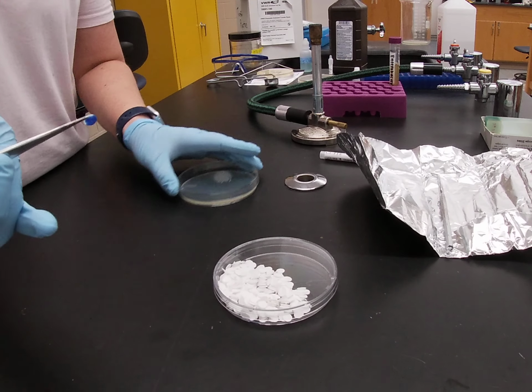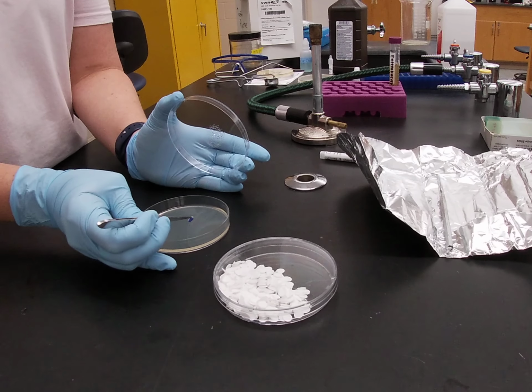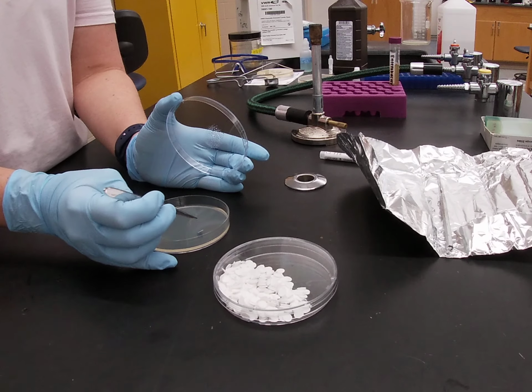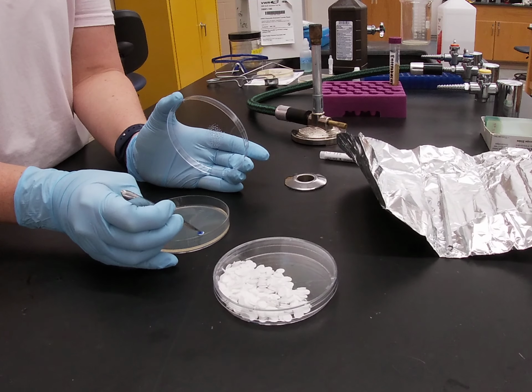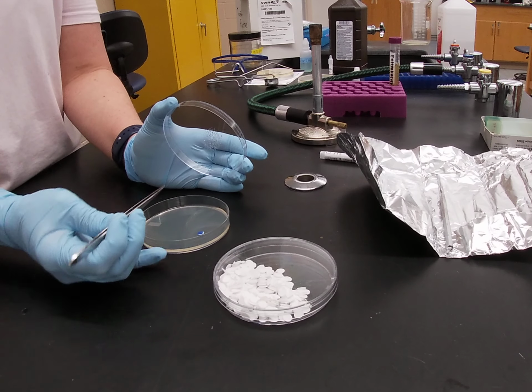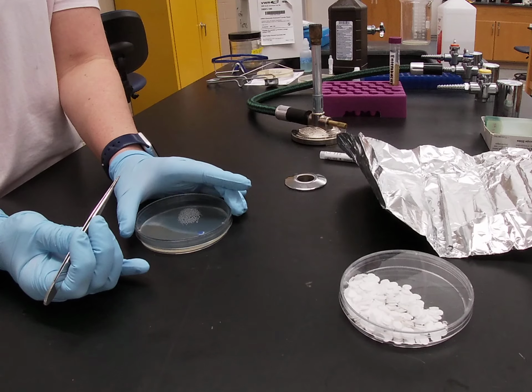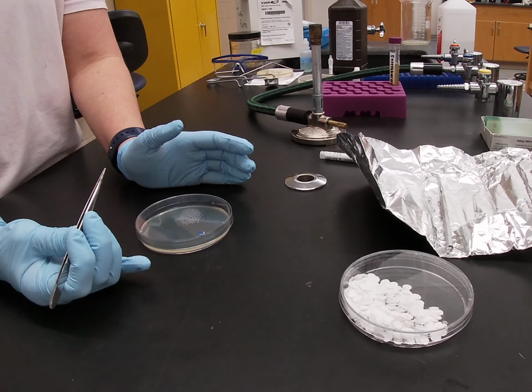You will then take your disc and put it directly into a labeled quadrant on your plate. And you want to use your forceps or use your blunt probe to tap it down well to make sure there is good connection between your disc and the plate. So that's how we make our own discs.